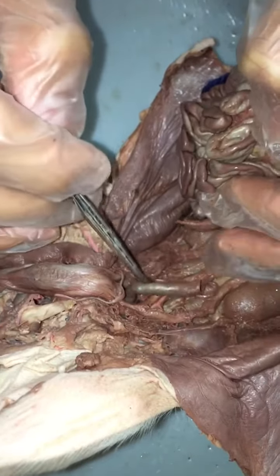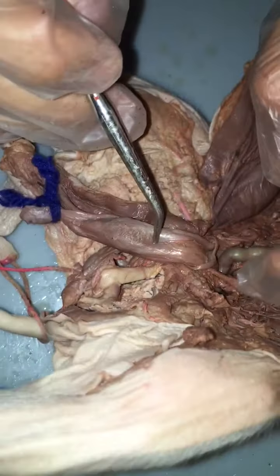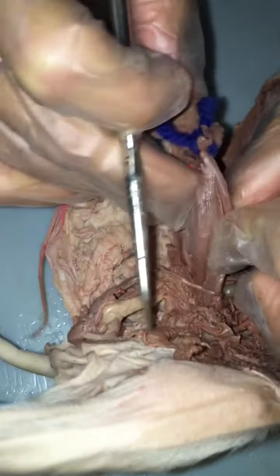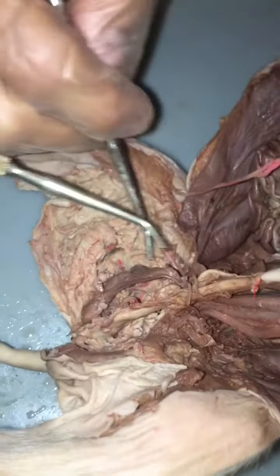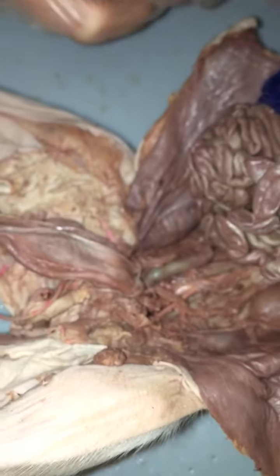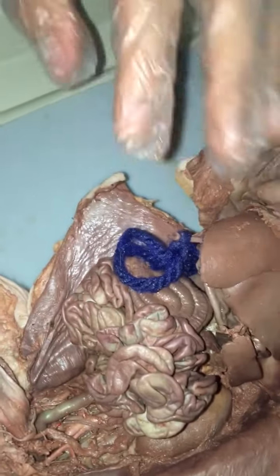Okay. Umbilical vein. It's right down the middle on that allantoic bladder. Where is it? Is it down underneath? Oh yeah, actually no. The umbilical vein is what we cut. This thing right here. You could say this is the umbilical vein. Well, that's massive. Yeah, that's the umbilical vein that we cut right here.